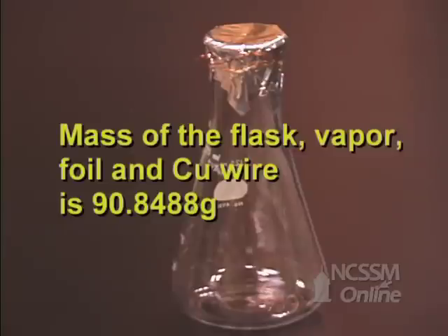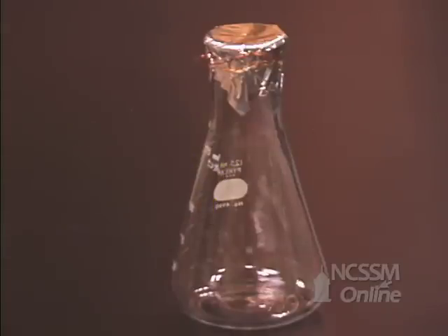Since we know the mass of the empty flask, aluminum foil, and copper wire, we can get the mass of the liquid.